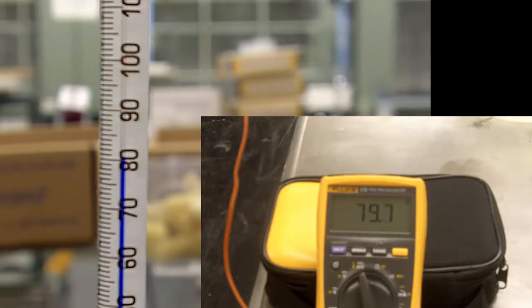When you do a meltemp you can go quickly up until the point where you are interested in the melting point region, then slow down to no more than a couple of degrees per minute. Once your material has fully melted, shut off the meltemp and watch to see if the temperature keeps going up. If it keeps going up, thermometer lag is an issue. If it stays the same or drops right away, you have read an accurate temperature for the sample chamber.